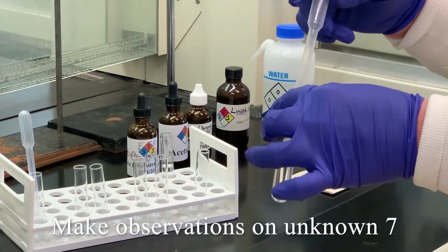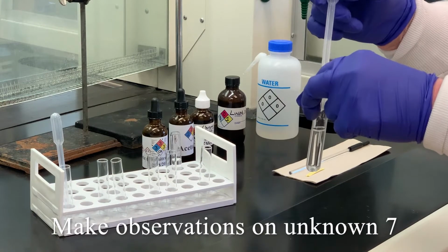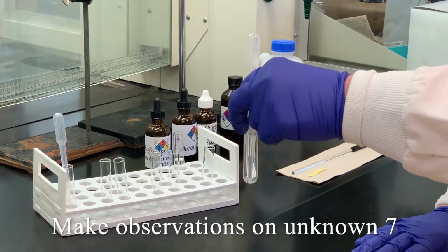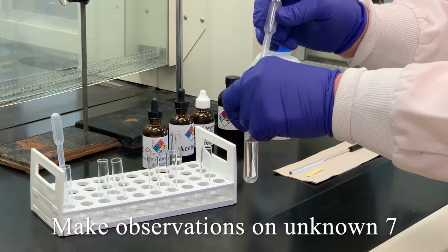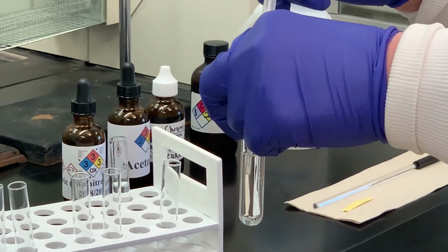One of the things we probably don't want to do is keep going back to that original container and taking stuff out for each test, just in case I contaminated the tip of the pipette. So this is our pure unknown number 7, and what I'd like for you to do is just to write down what you see in terms of what physical state it is, what color it is. If it's colorless, state that, so on and so forth.